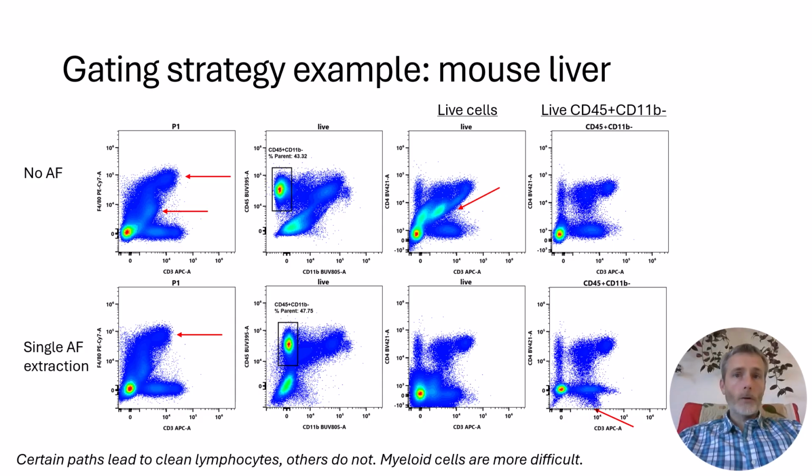In this example, we can create a path to allow clean gating on CD3 versus CD4 to identify lymphocytes by first excluding CD11B positive cells. Without that exclusion, the CD3 versus CD4 plot is heavily contaminated by uncorrected autofluorescence, primarily from macrophages, as we see by this plot of F480 versus CD3. These cells will be autofluorescent in several channels in the data.